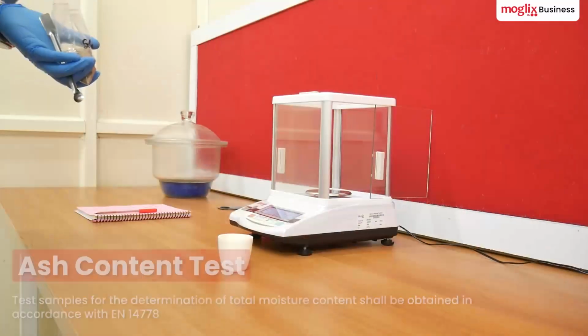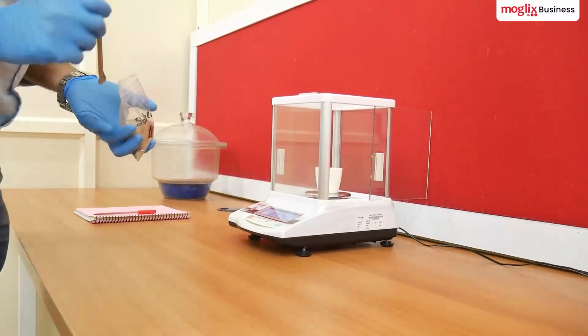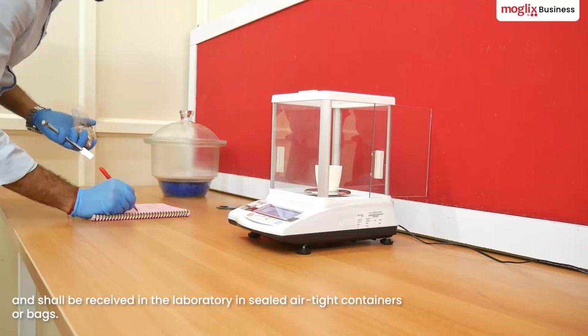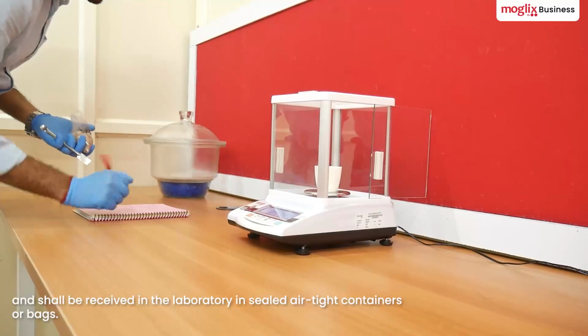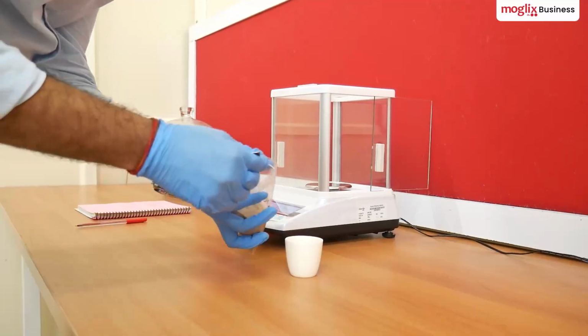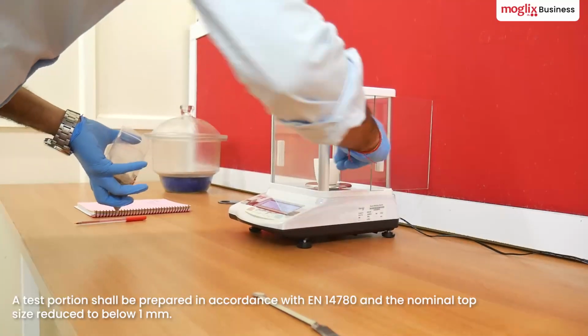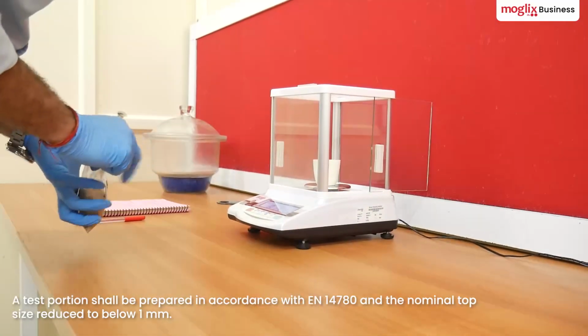The second test is the ash content test. The first step is sample preparation. For sample preparation, we first weigh the empty dish and note down its measurement. The sample is then transferred to the dish and the weight with the sample is measured and noted down before proceeding for the test.